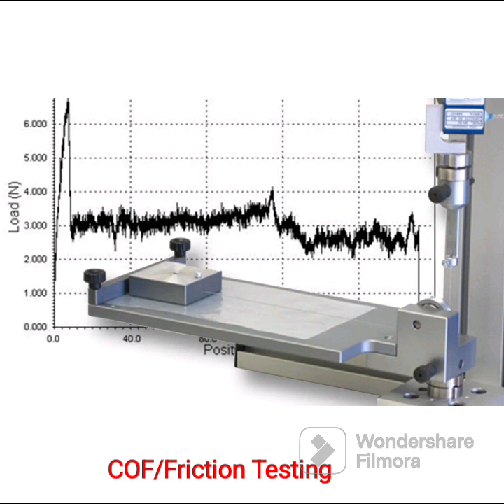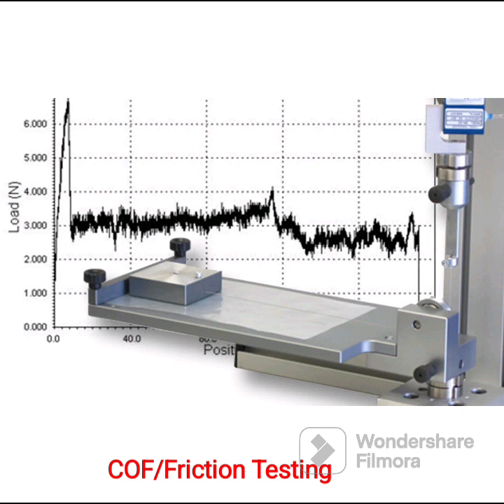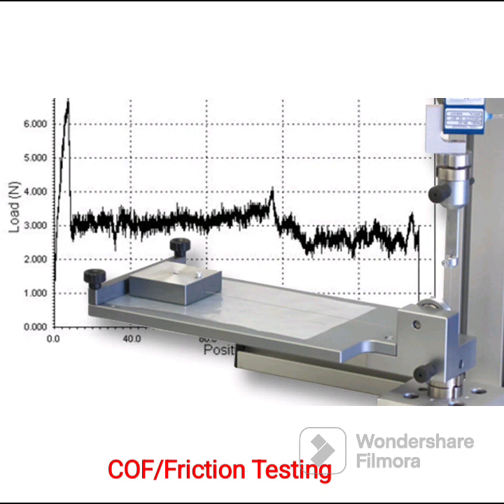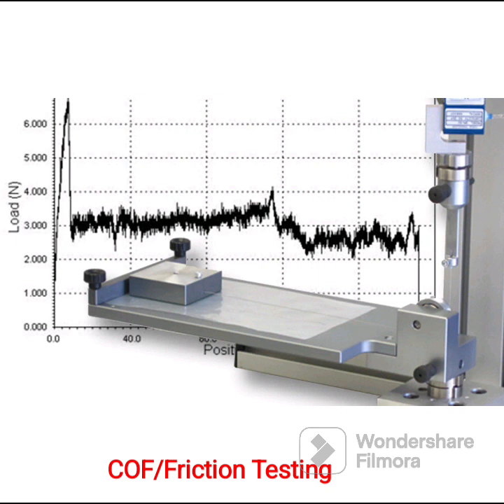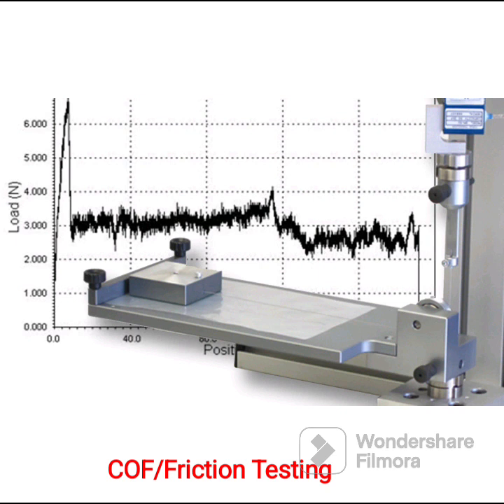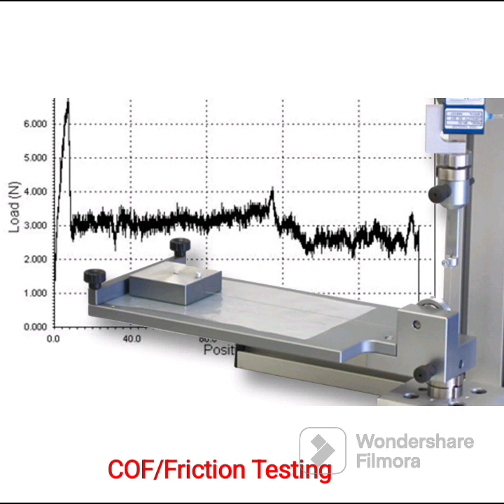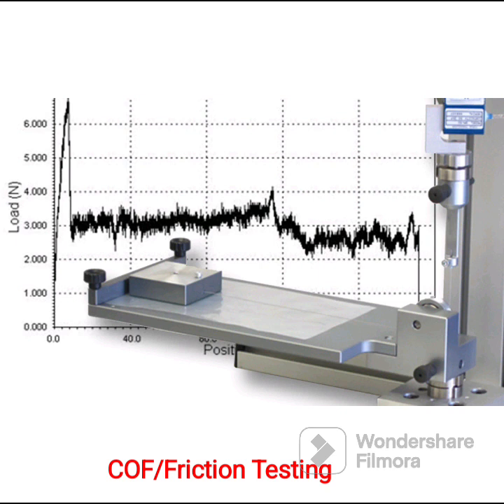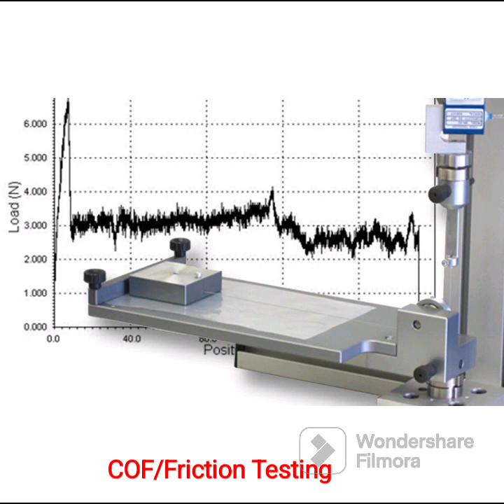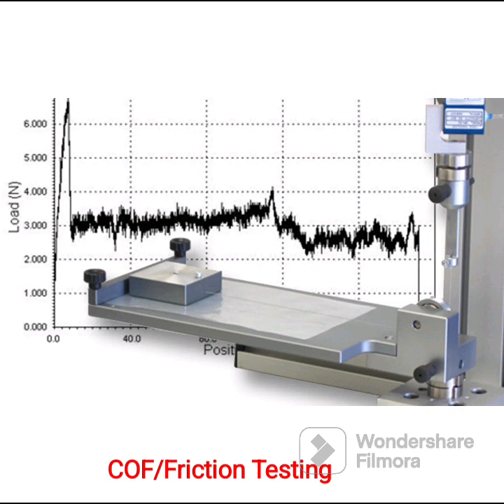During a test, an inclined plane is increased at a rate of 1.5 plus or minus 0.5 degrees per second by an electric motor until the test block begins to slide. The initial movement of the sled is the slide angle or coefficient of static friction of the materials. When the test block just begins to slide, a photo-optical sensor automatically stops the inclined plane and the operator can read the slide angle result.